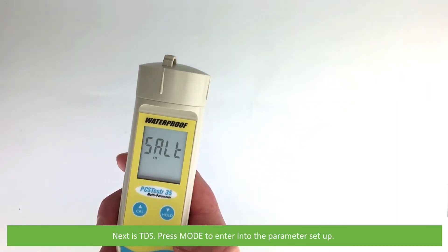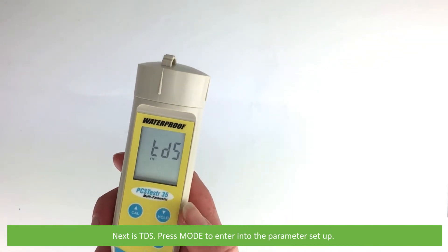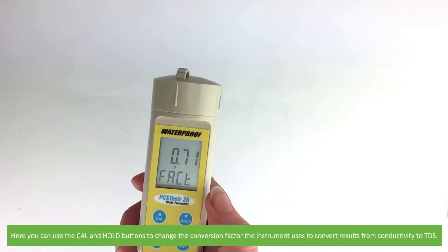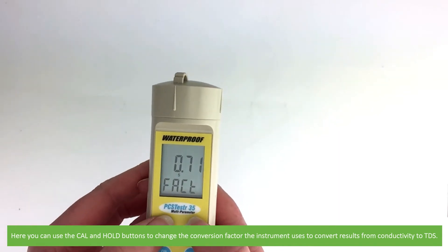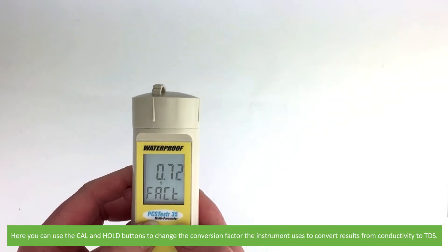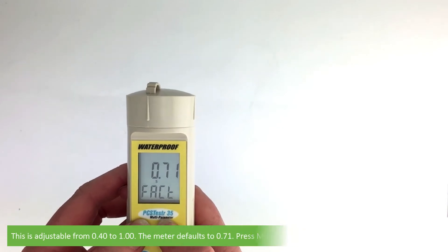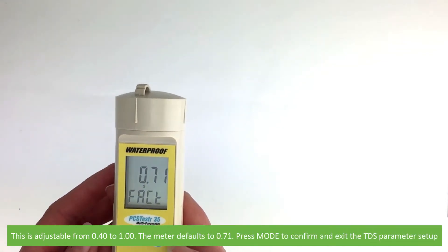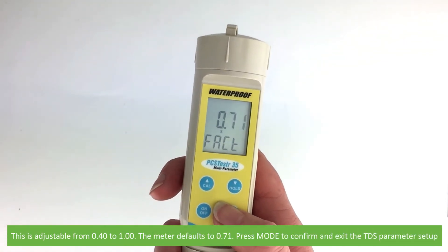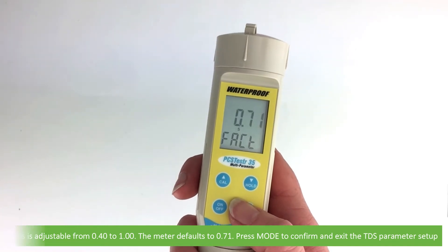Next is TDS. Press mode to enter into the parameter setup. Here you can use the cal and hold buttons to change the conversion factor the instrument uses to convert results from conductivity to TDS. This is adjustable from 0.4 to 1, and the meter defaults to 0.71. Press mode to confirm and exit the TDS parameter setup.